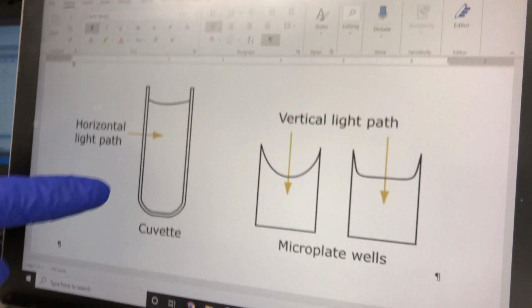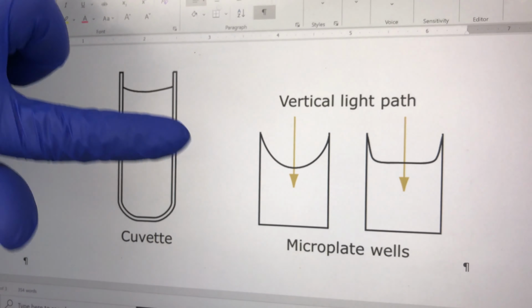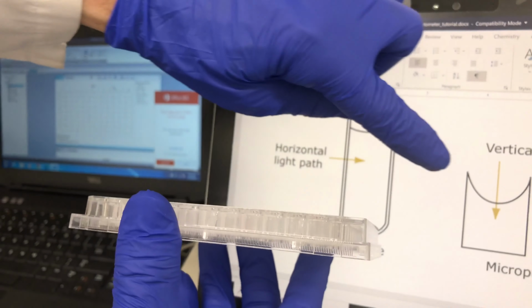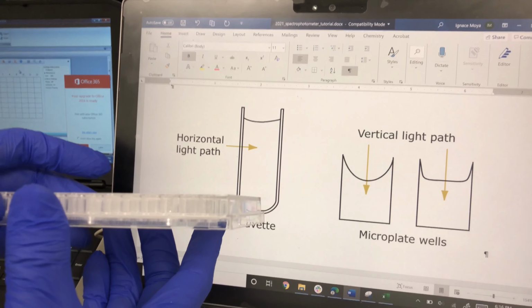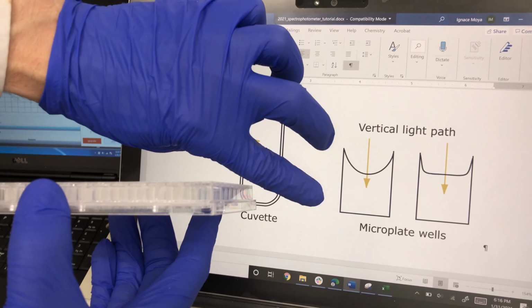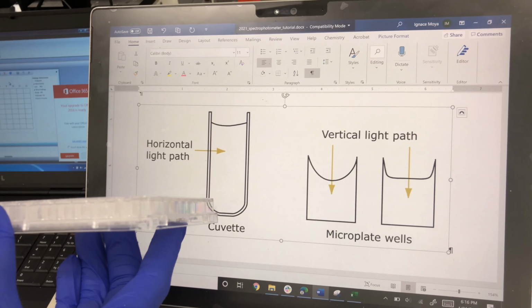So if we look over here at this diagram, here I show the cuvette and microwell plate. Again, as I said before, this is a fixed path length because the light's going this way, but the problem with the microwell plate is that we'll have either a meniscus, depending on the solvent we're using, and second, this will be variable. If you have some pipetting error, the path length will always change, and that's going to be a problem getting reproducible data.